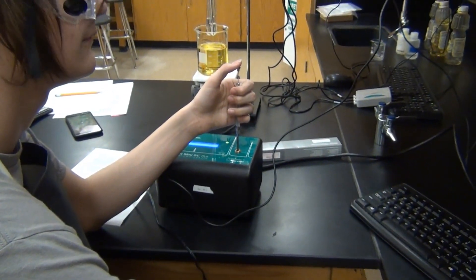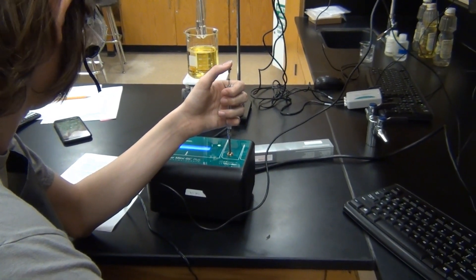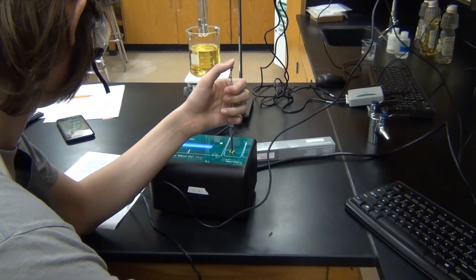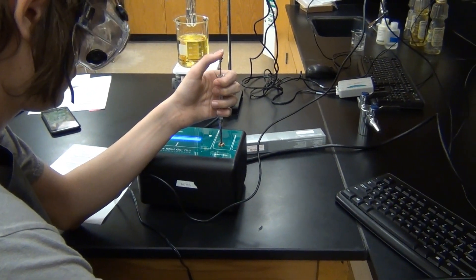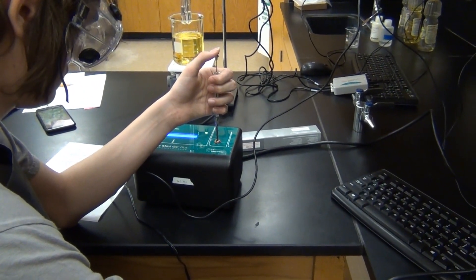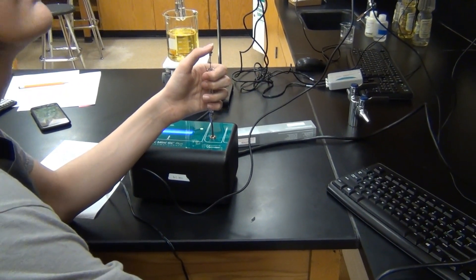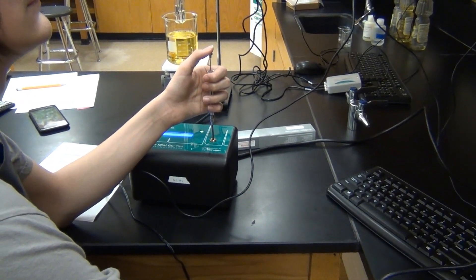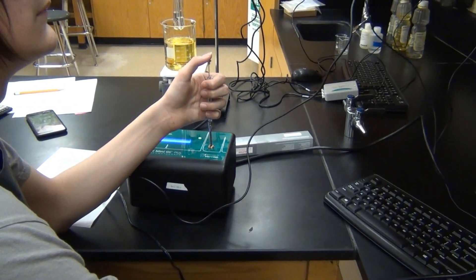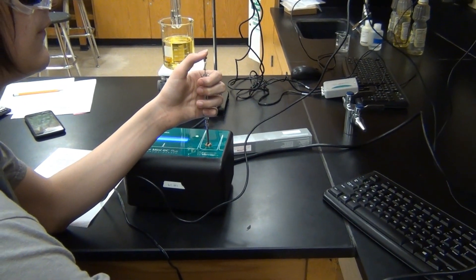We have a sample in the syringe, and it is inserted into the GC. Now we're going to insert the sample and hit collect so that we can collect our data with the GC.